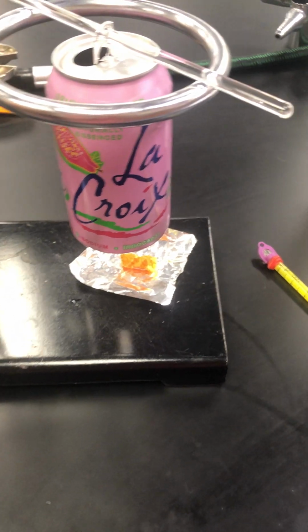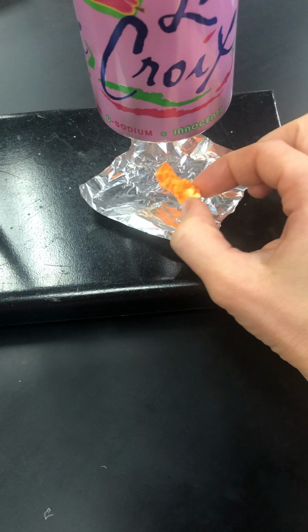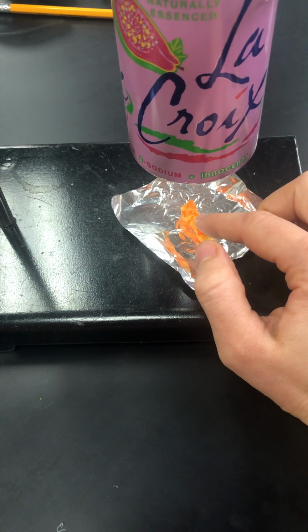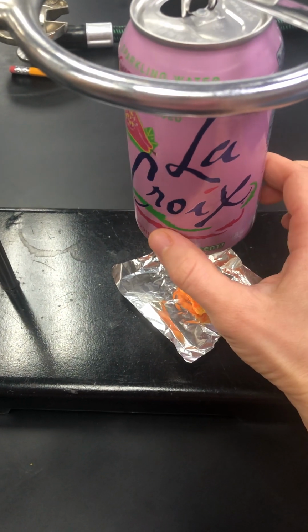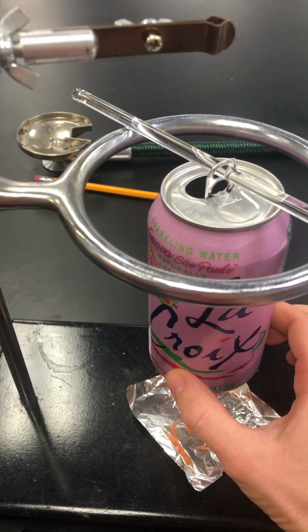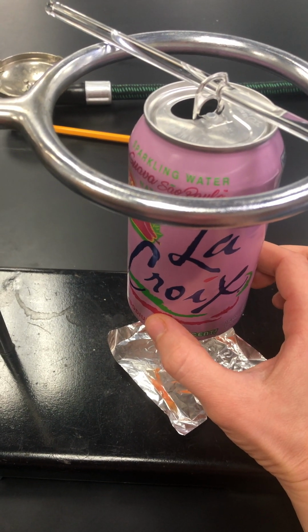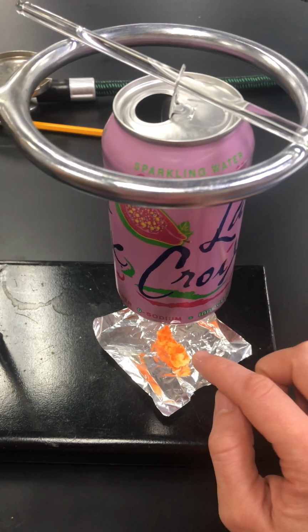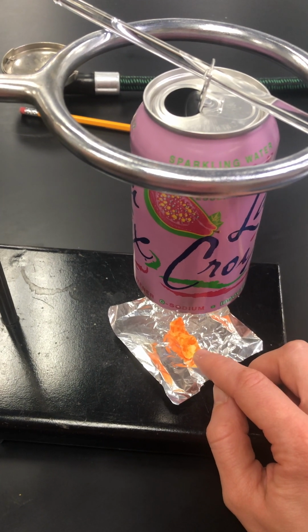So essentially, what we're trying to do is quantify how much energy is going to burn in this Cheeto. So we'll light it on fire. And we're assuming that the energy, for the most part, is going up to what we call our calorimeter. Now, a calorimeter is just a device we use to quantify temperature change. So we're going to be taking the temperature of the water in this can and seeing what temperature it rises to. And that rise in temperature is going to directly relate to how much energy was in the Cheeto. And we'll do some math with that with our analysis questions, okay?